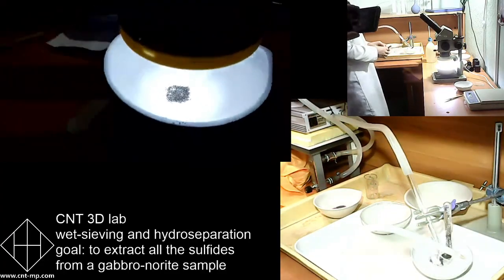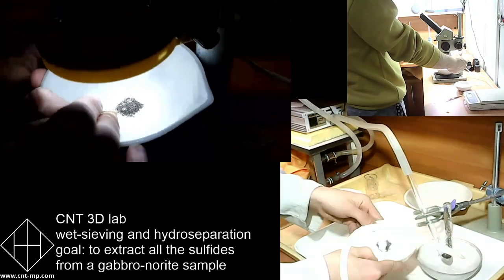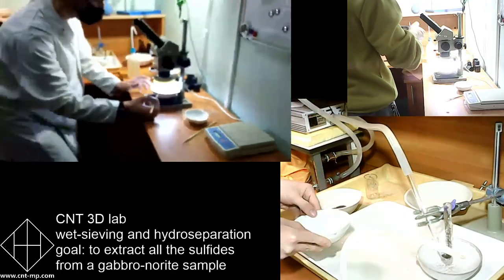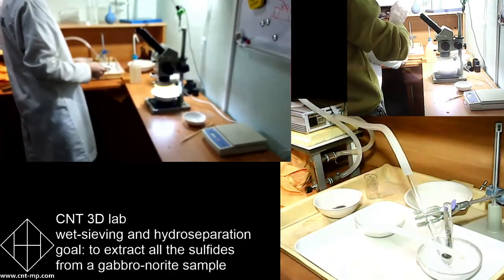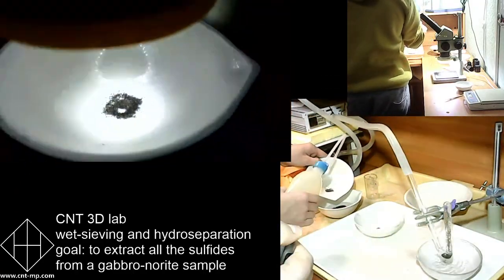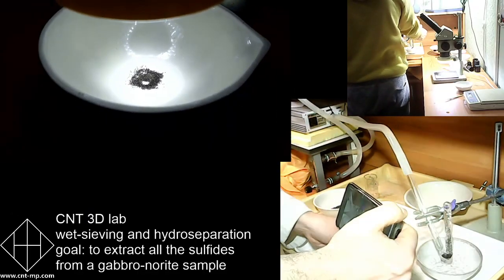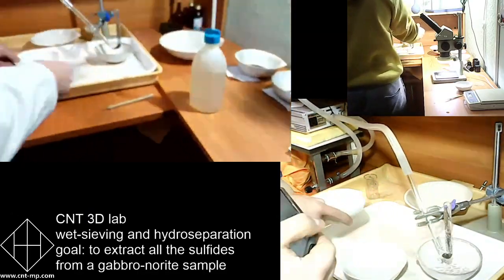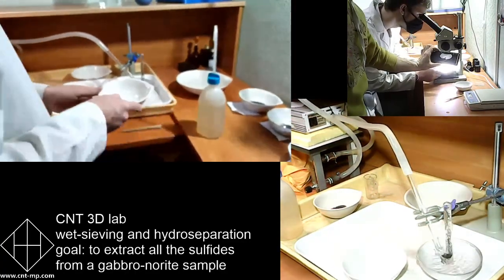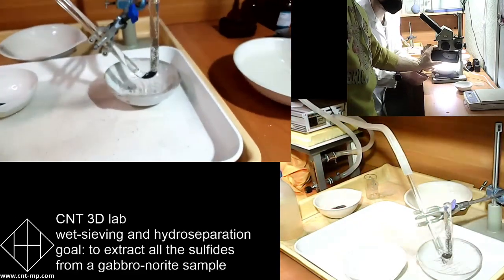Every time you switch the dishes, it is possible to see what particles are coming up out of the tube. You can always use the needle to make sure what these minerals are that are coming out as single particles, as single mineral grains that were recovered by EPD. Supposedly they all are single mineral grains or crystals.